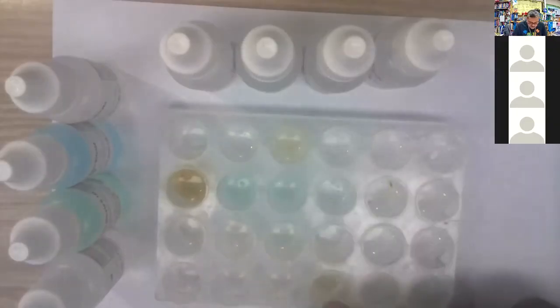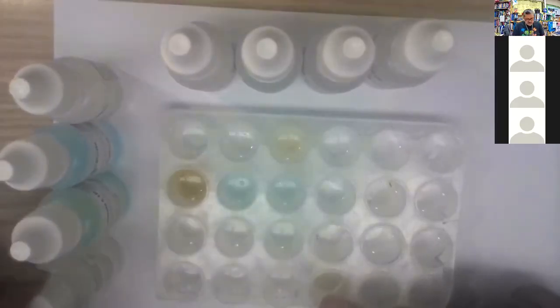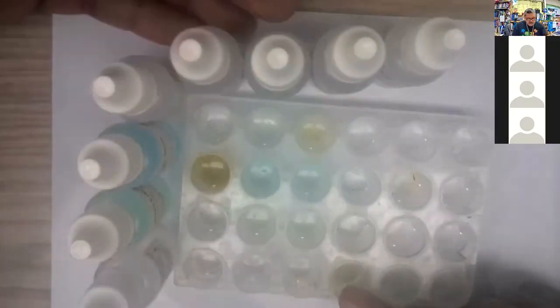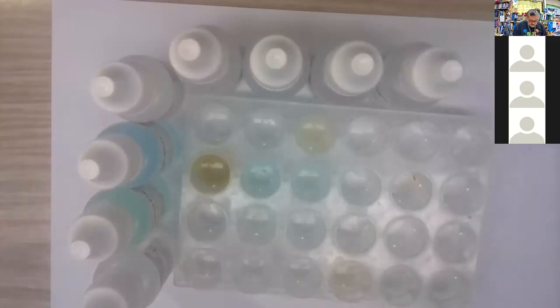And then the other one that we saw was in the bottom right corner, sodium sulfate and zinc nitrate seem to have some kind of reaction. Okay, so they were all color reactions, no strong precipitates that we were able to see. Look over here, just looking for powder. Don't see much. How about over here? Looking for a powdery substance, not here.